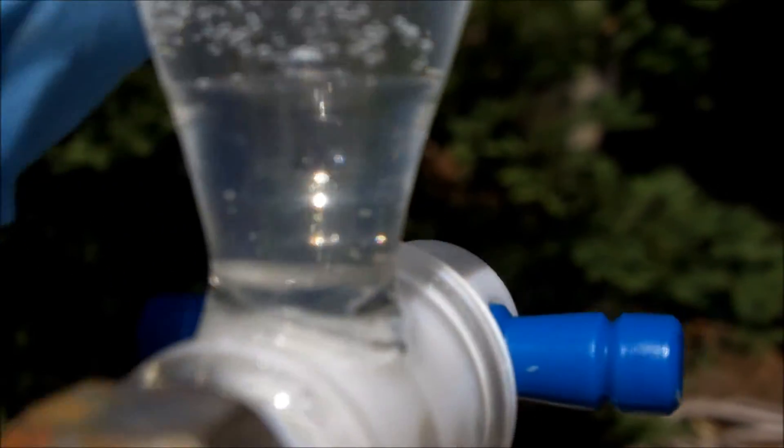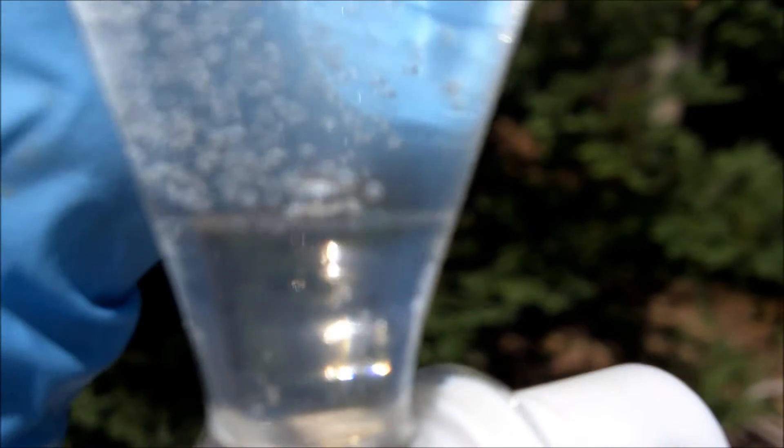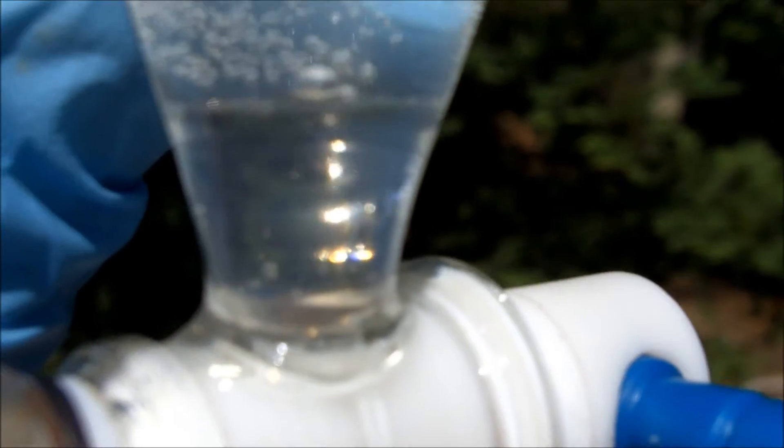But I don't think there's much of a use for bromoform for the home chemist. I more just wanted to show what it looked like and how it was made. So it's that clear liquid down there.